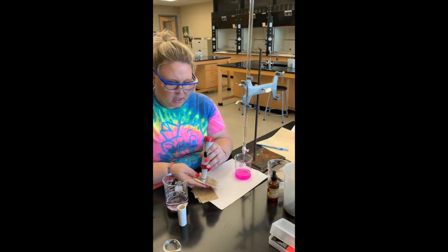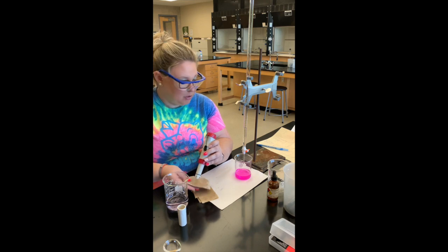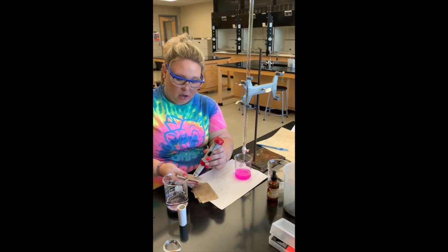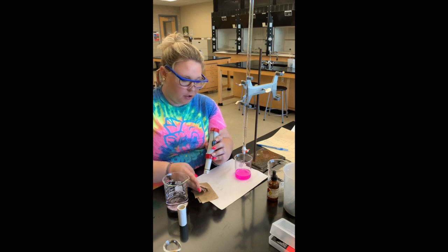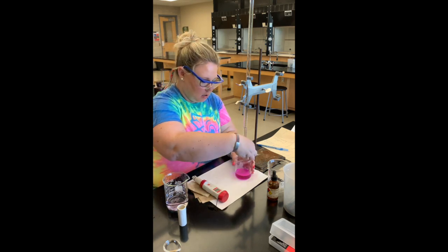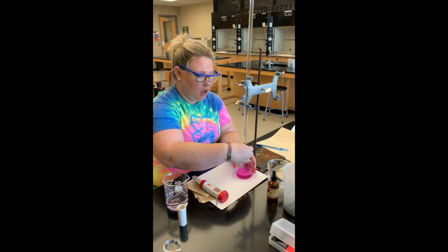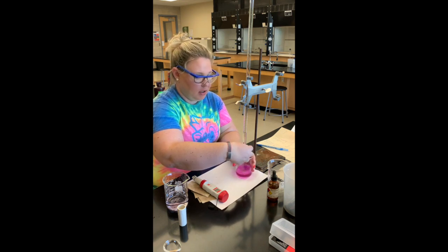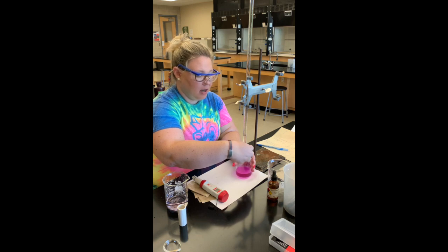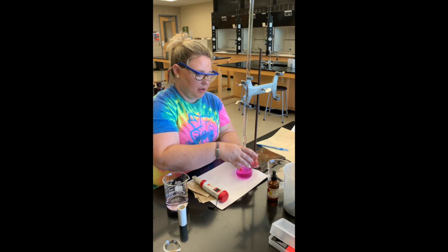Our pH has kind of leveled off and isn't really increasing anymore, so I'm going to add four more milliliters to get our last point for the graph. Again, this data will be in your PowerPoint so you can make your graph and then calculate the pKa and the Ka from that.